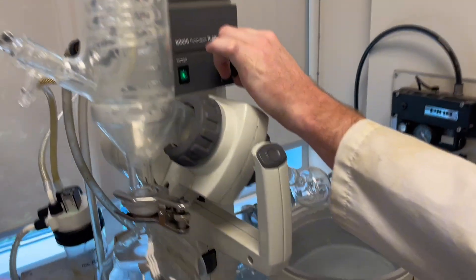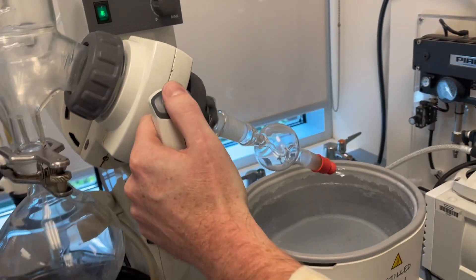Then turn the rotation on here and lower it into our water bath using this button.